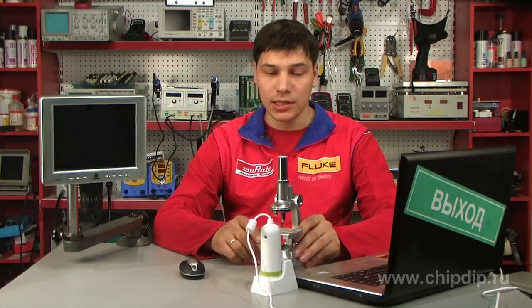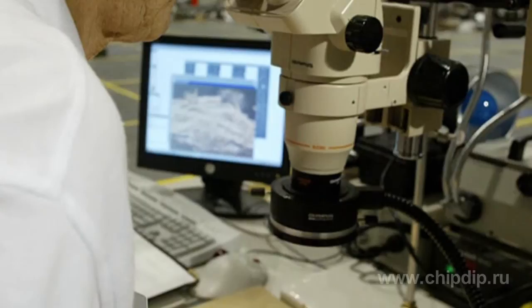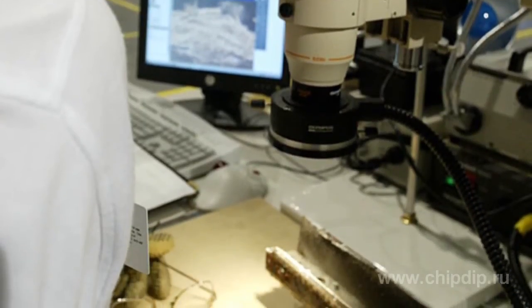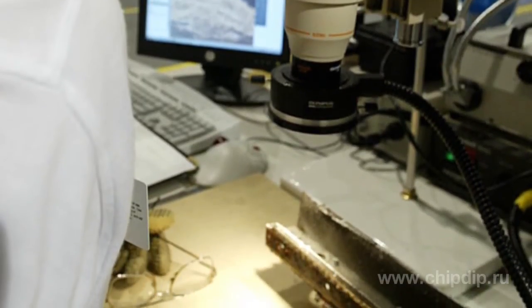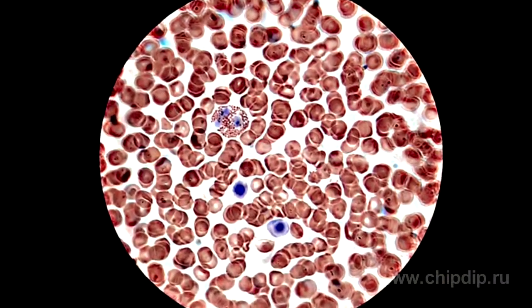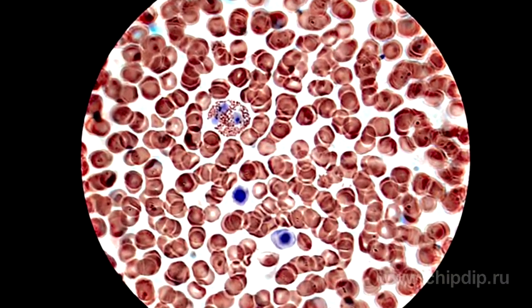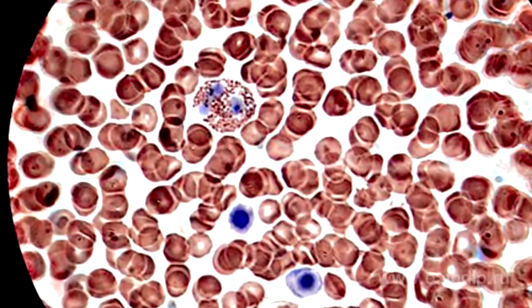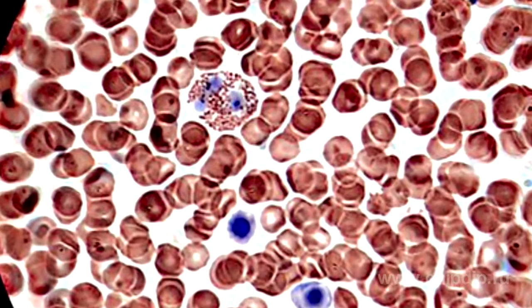Here is another important and interesting technical question: What is the resolving power of optical instruments? Looking through a microscope, we want to see the whole object at once. This means that if we are looking at, for instance, a bacterium with two spots on its sides, we expect to see both spots if we magnify the image.